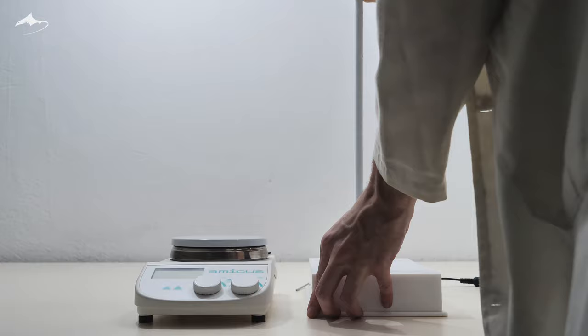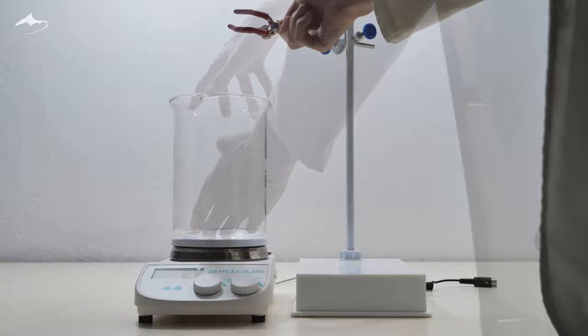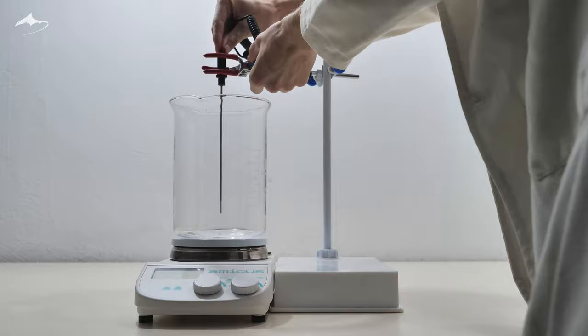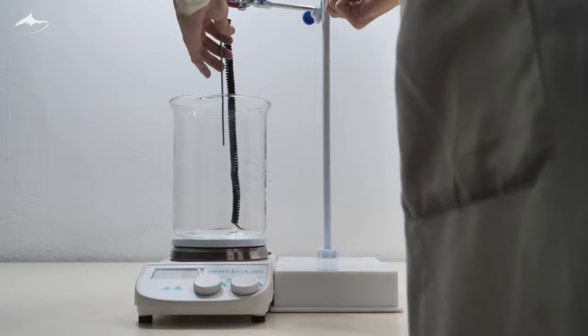Let's start the procedure. In order to perform the recrystallization, a water bath setup was arranged. My setup consisted of a hot plate stirrer, a 2 liter beaker and a thermal probe which is very important to maintain a consistent temperature.